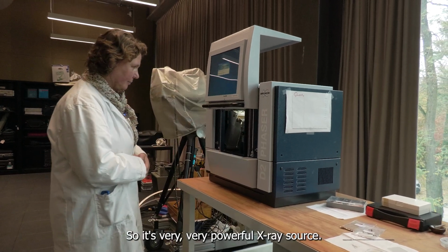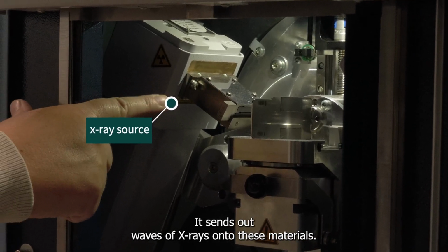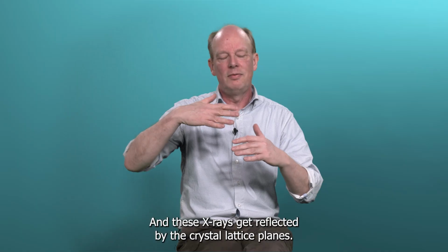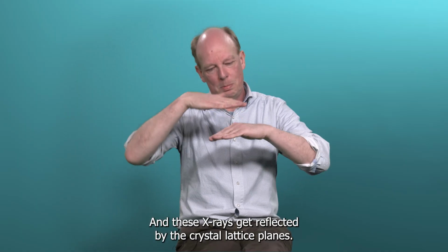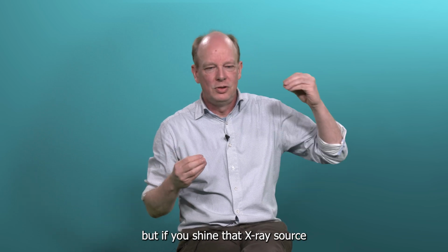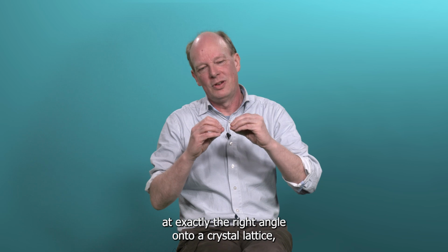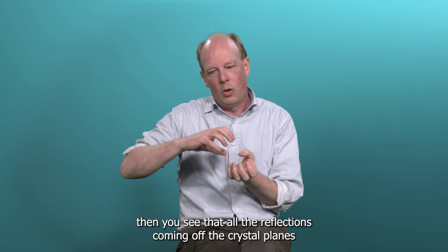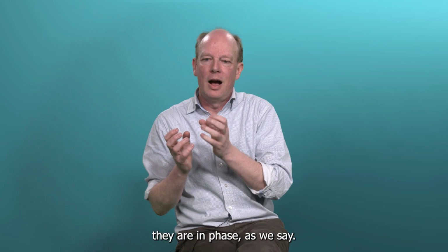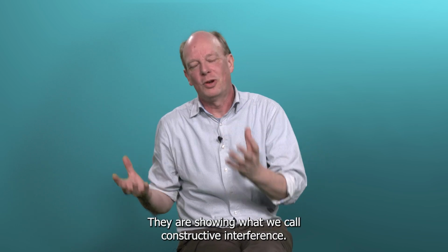So there's a very, very powerful X-ray source. It sends out waves of X-rays onto these materials. And these X-rays get reflected by the crystal lattice planes. Now, that happens all the time, but if you shine that X-ray source at exactly the right angle onto a crystal lattice, then you see that all the reflections coming off the crystal planes are in phase, as we say. They are showing what we call constructive interference.